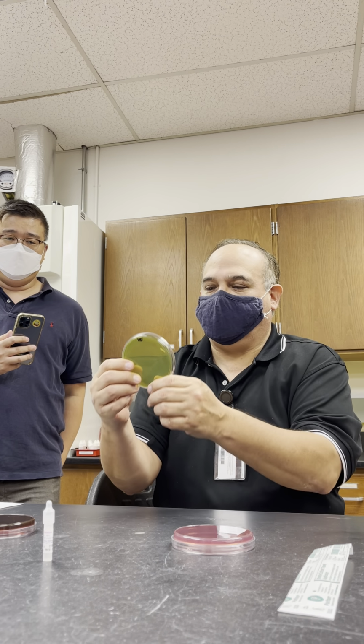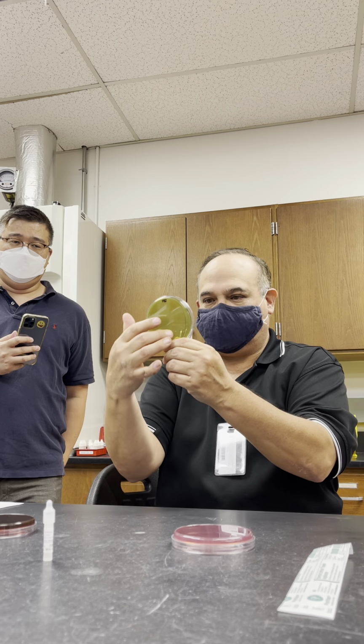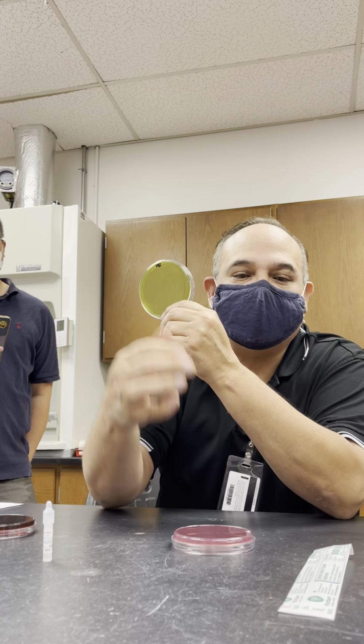But what you're going to do here for me is draw four equal quadrants on this plate. You're going to put these organisms on there. So you're going to put Proteus, Salmonella, Enterococcus faecalis, I think. Let me look.